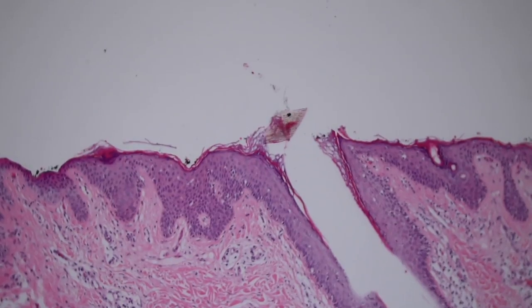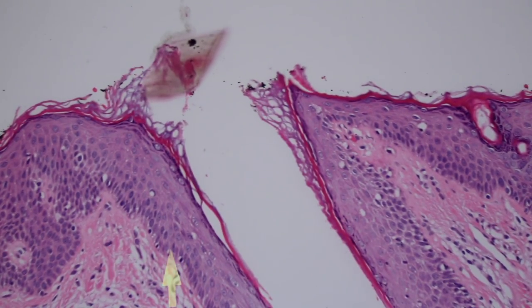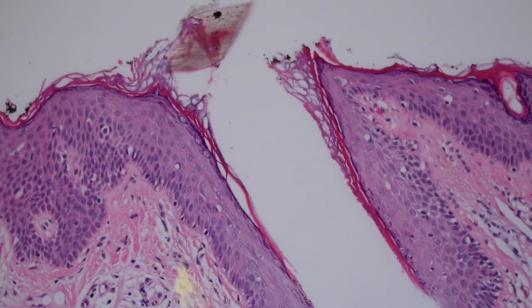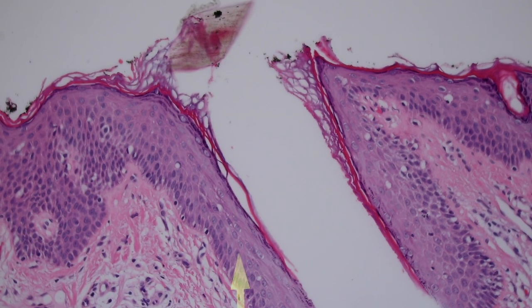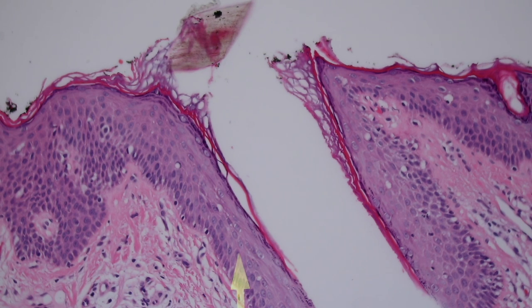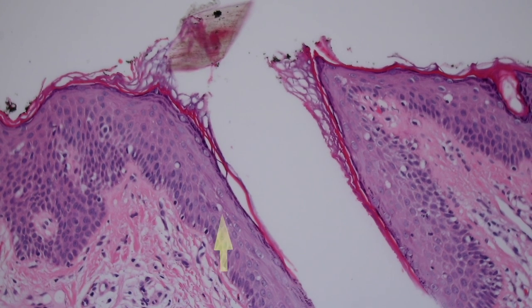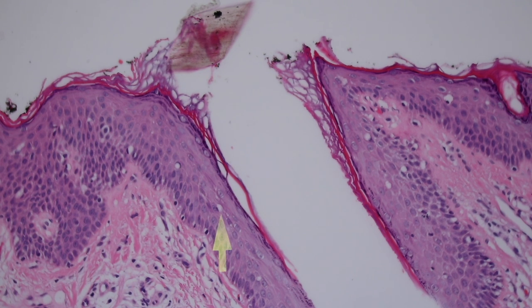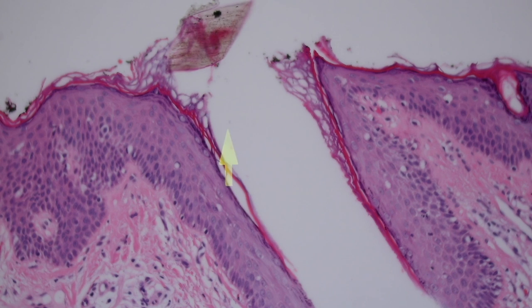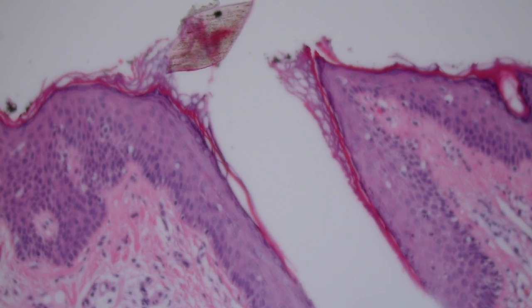The follicle opens up on the surface. The portion where the sebaceous duct drains in is called the isthmus, and the portion above that opening to the surface is called the infundibulum. The infundibular portion of the hair follicle looks just like the epidermis. In pathology, we talk about epidermal inclusion cysts — surgeons call them sebaceous cysts, though they're not actually sebaceous. They are really follicular cysts of the infundibulum, lined with infundibular epithelium and containing flaky loose keratin in the middle.